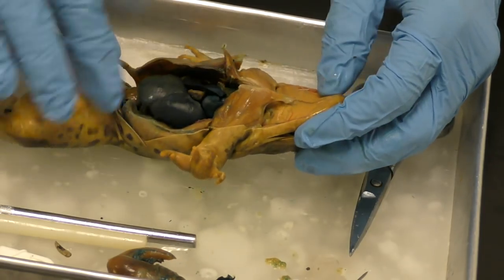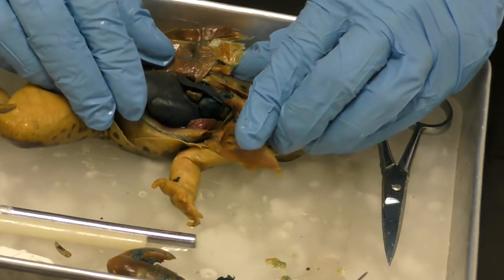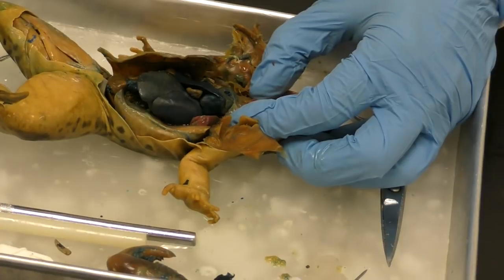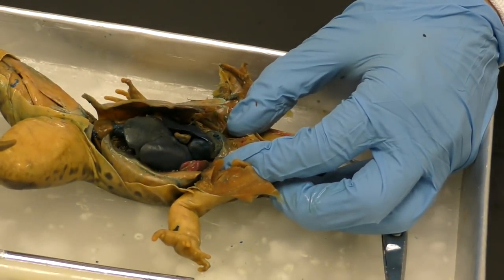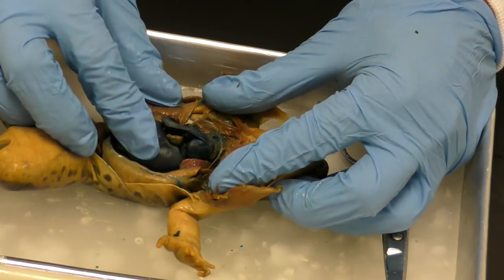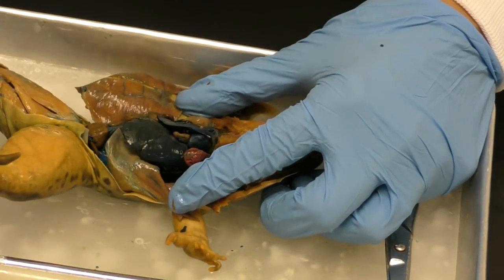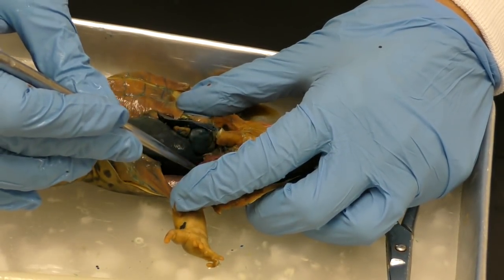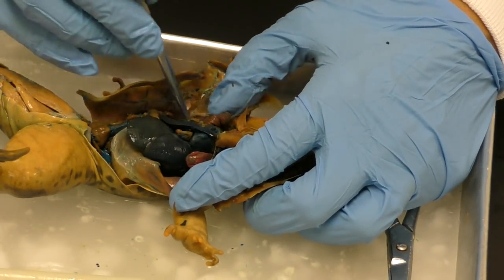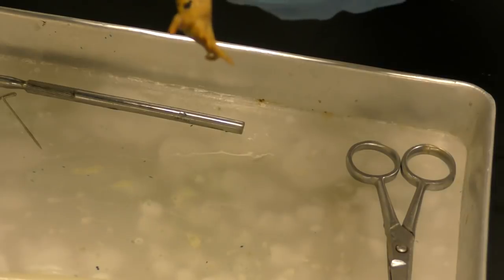Their pores are very, very active in aiding in their cellular respiration. Okay, so we've talked about the nostrils, we've talked about the trachea, and then this organism, just like humans, have two lungs. And that's these guys right here, these little pink, tiny. I mean, their lungs are so much smaller compared to other parts of their body.